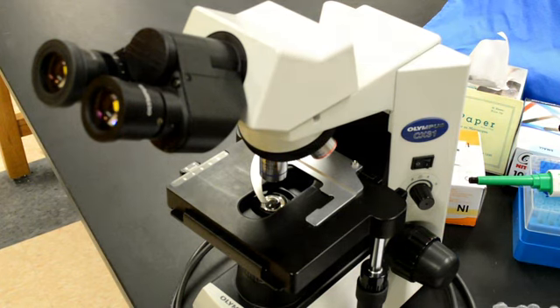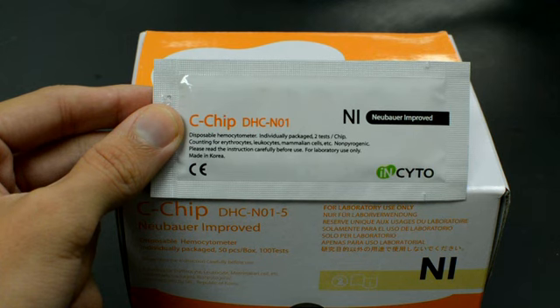A microscope with at least 600 times magnification and a disposable hemocytometer.